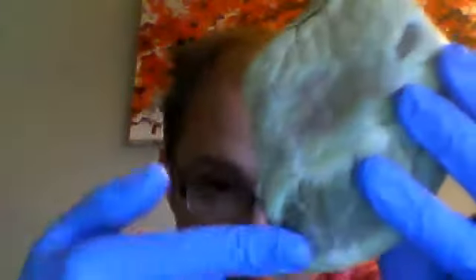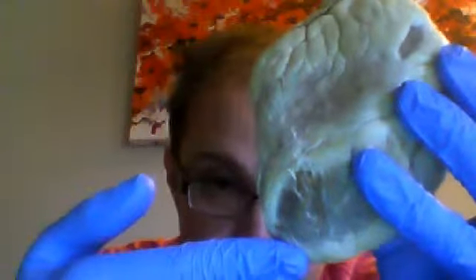We have the apex and the base of the heart. The apex of the heart is located right here. Apex is actually the point you would think of at the bottom of the heart because it's the area that's furthermost towards your feet. And then you have the base of the heart, which is this area up here, and that's the area that's more cephalic. So the base and the apex, kind of like if it were a mountain, it's switched around.